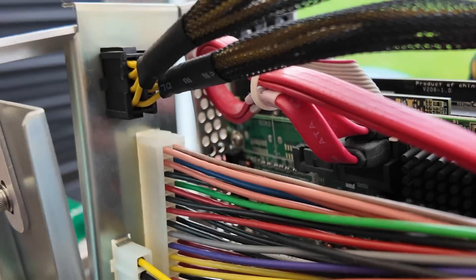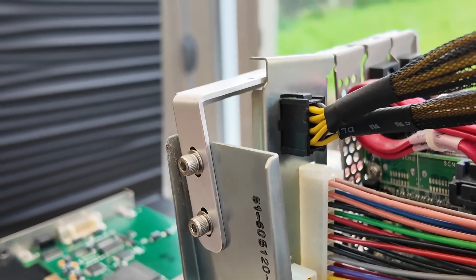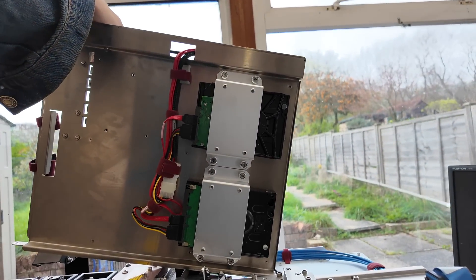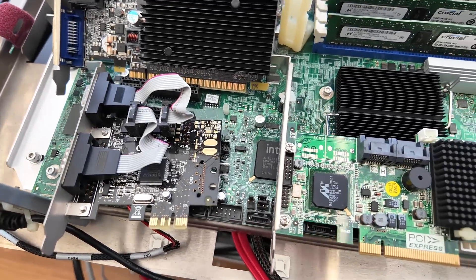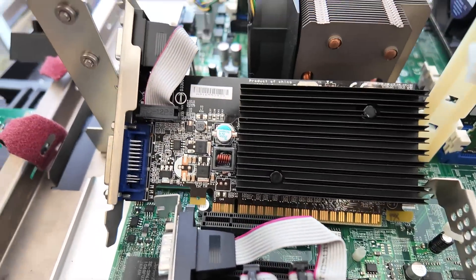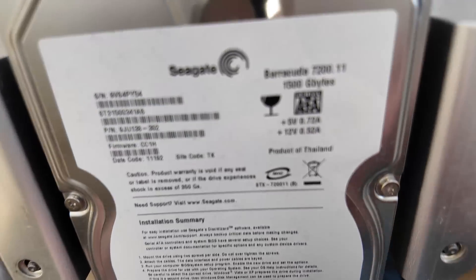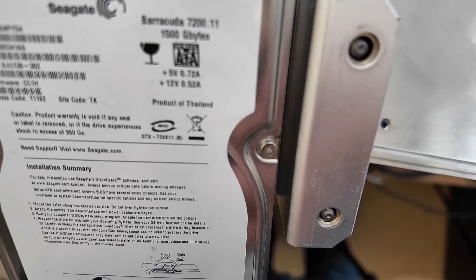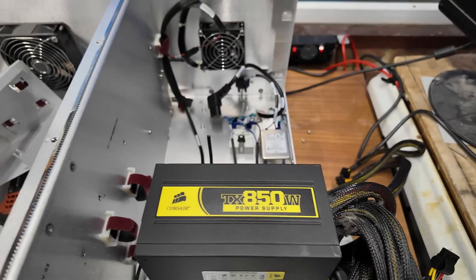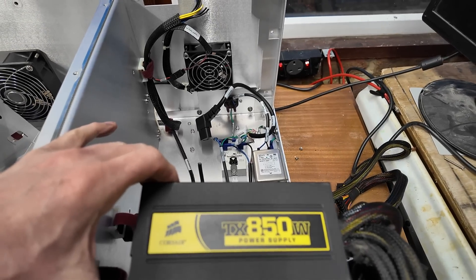There's just a custom plate here for passing through all these power connectors, to allow the whole assembly to slide out. Underneath this plate there's a pair of hard disks. The other cards seem fairly generic — I can't see any maker's names on any of them. RAID, hard disk controller, dual serial port and graphics. This is an Intel S5520HC server board. The drives are Seagate Barracuda 1.5TB each, 7200rpm. And just in case you're wondering what sort of PC power supply they use in a $300,000 kit — this is a Corsair TX850.